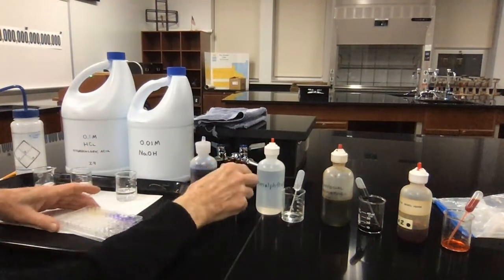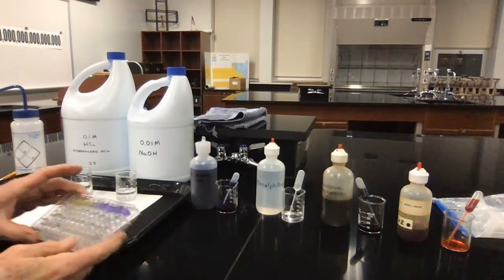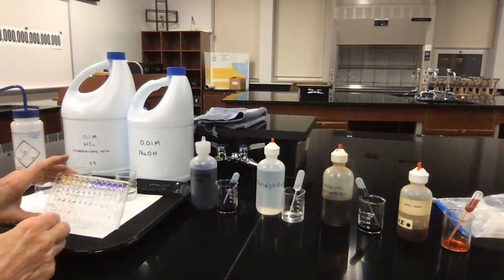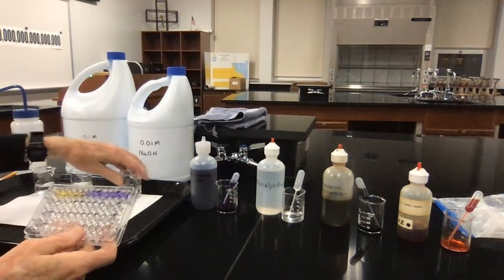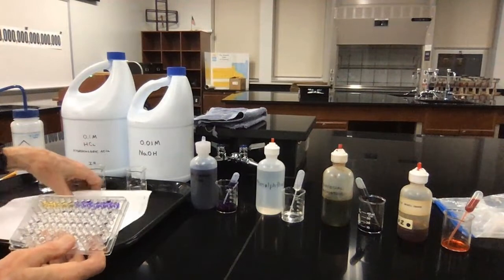And I'll put this back, and I give it a little tap just to gently mix it. And here's my set of liquids, and let me put this up against a piece of white paper so you can see this better.